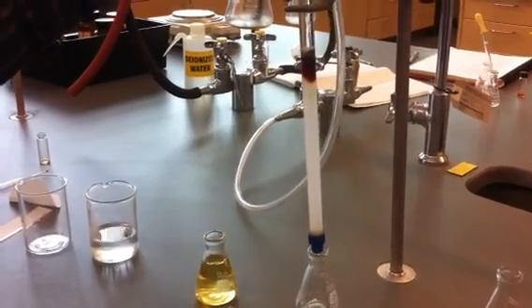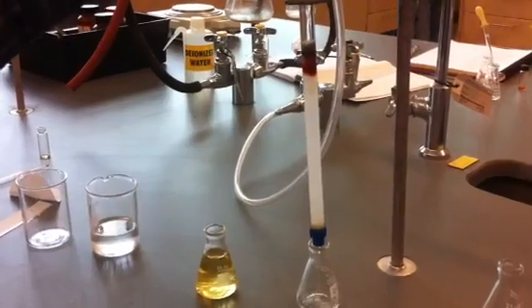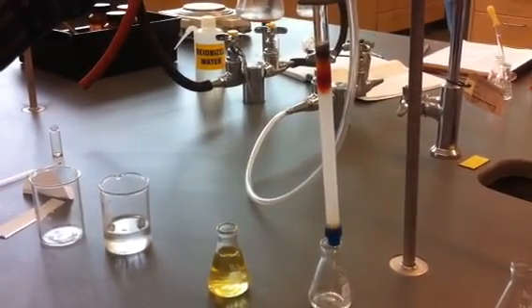Okay, so now we've switched to 30% ethyl acetate in hexane, and you can see the acetylferrocene band now coming down the column.